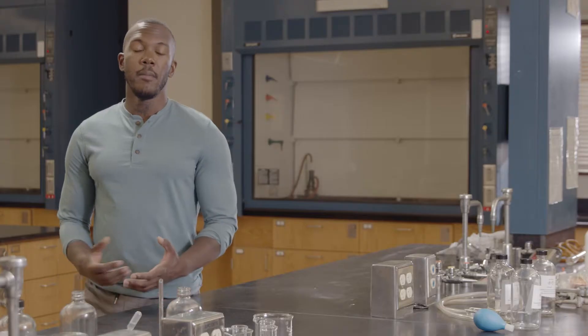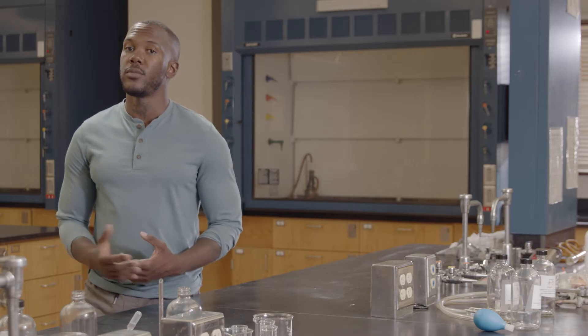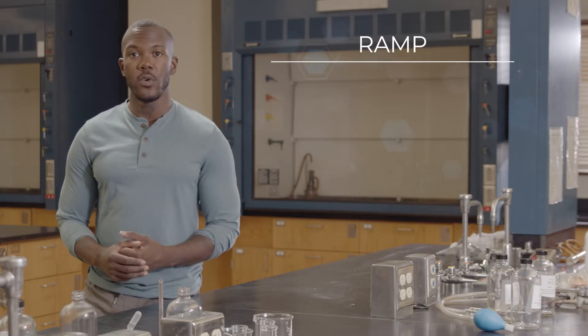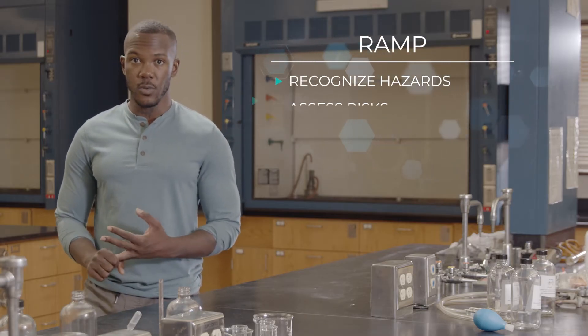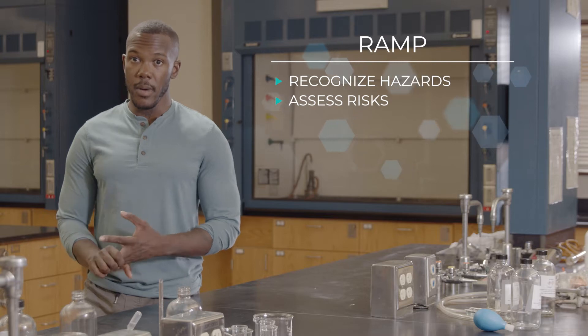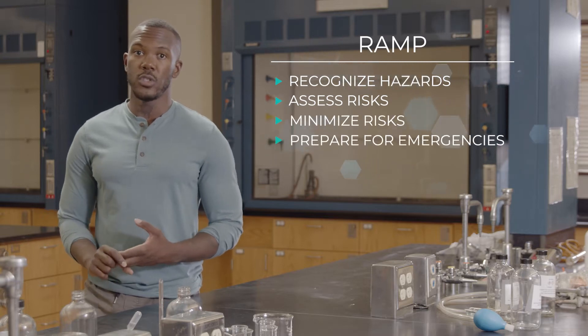In this video, you'll learn general methods and strategies for minimizing risk when using chemicals and lab equipment. Minimizing risk is part of a larger process called RAMP. RAMP stands for Recognize Hazards, Assess Risks, Minimize Risks, and Prepare for Emergencies.